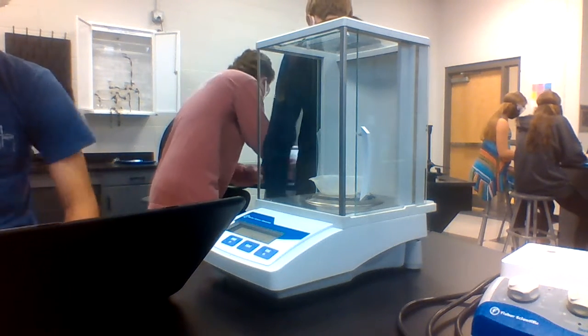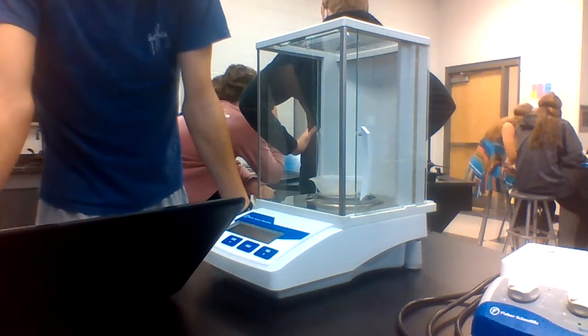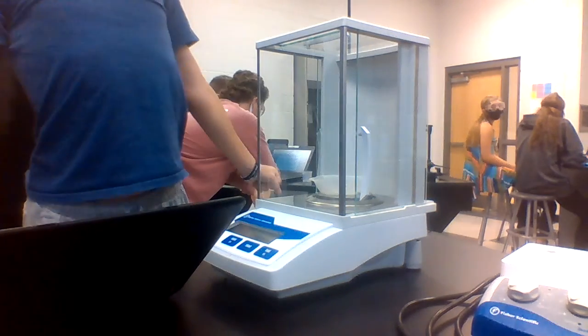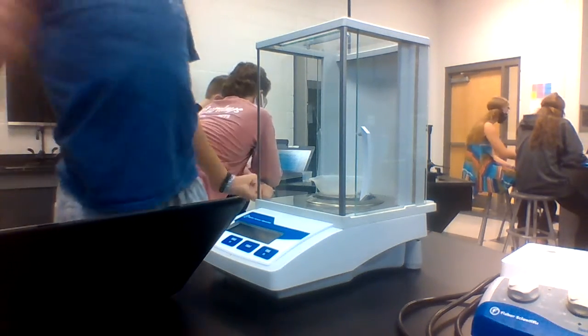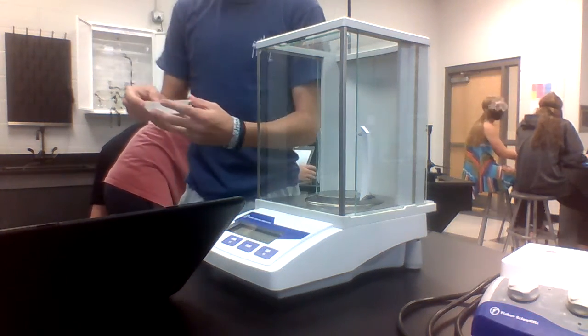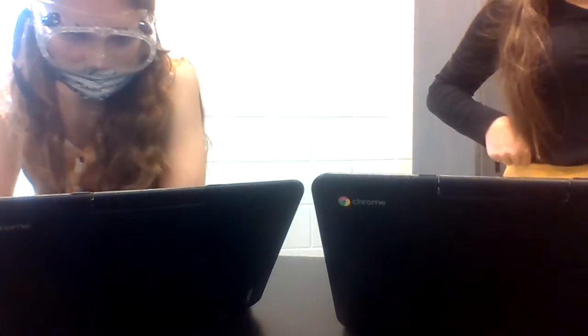But in your volume measurement, are you very accurate with that beaker? No. So you're not going to say 1.0 milliliters because you have no idea where that decimal point is. You're just going to say 1 for the beaker. When you get to the graduated cylinder, that's probably going to be different. You can measure out to that first decimal point.